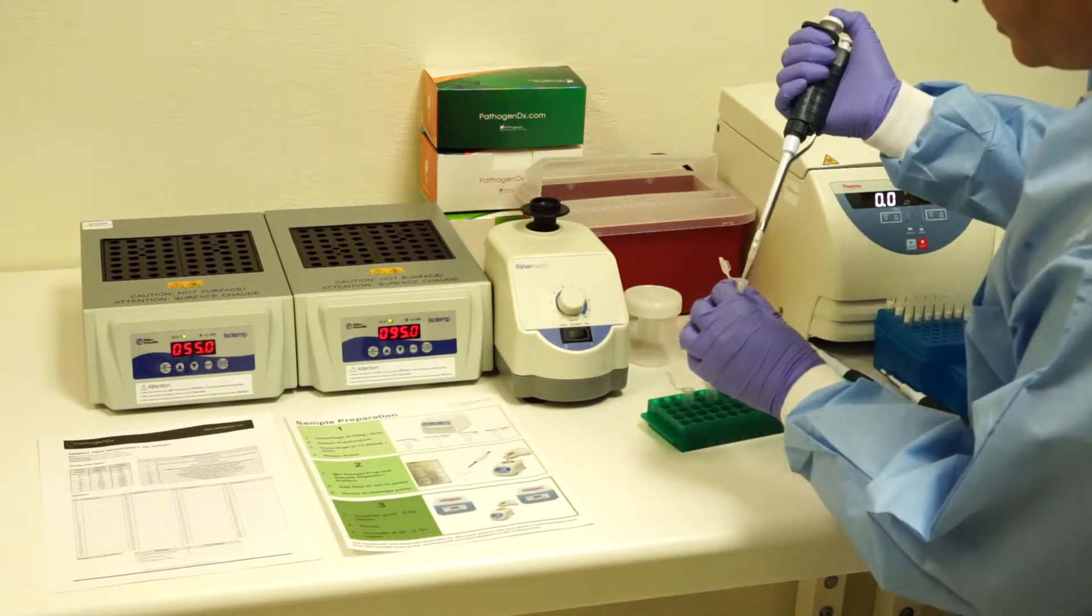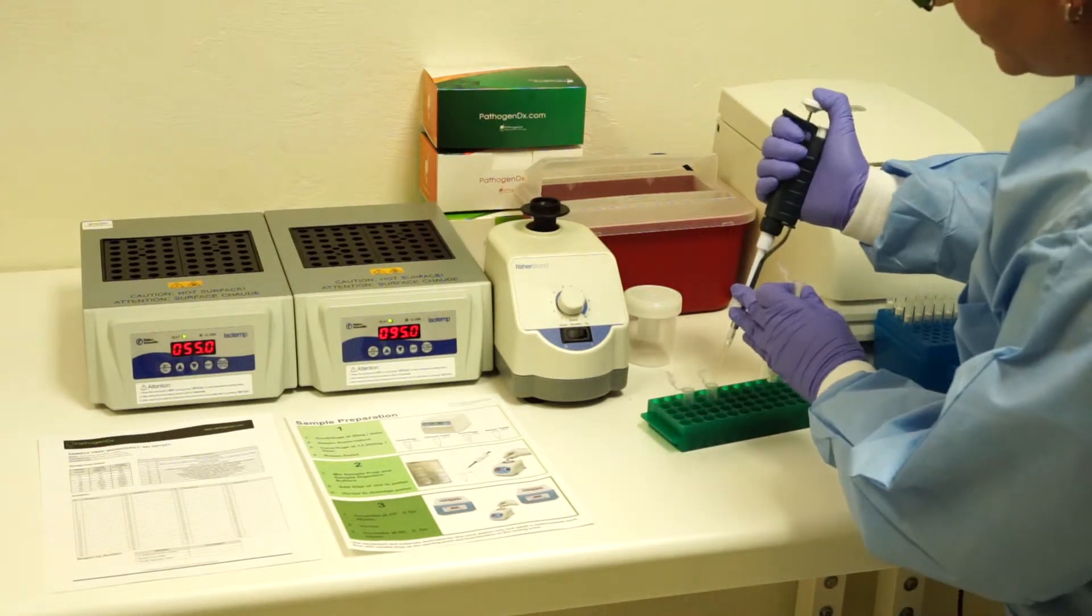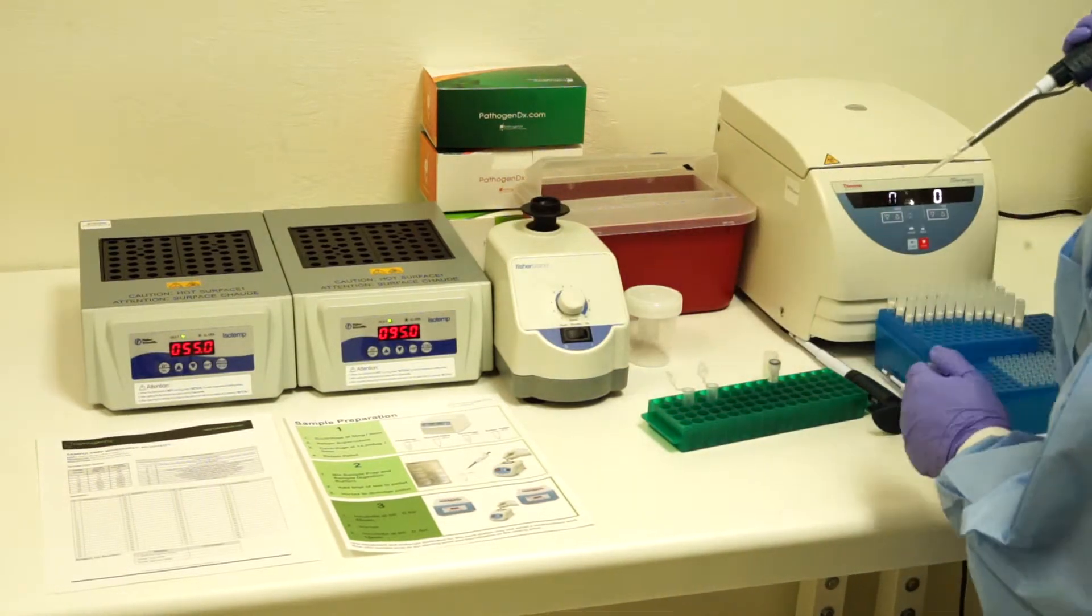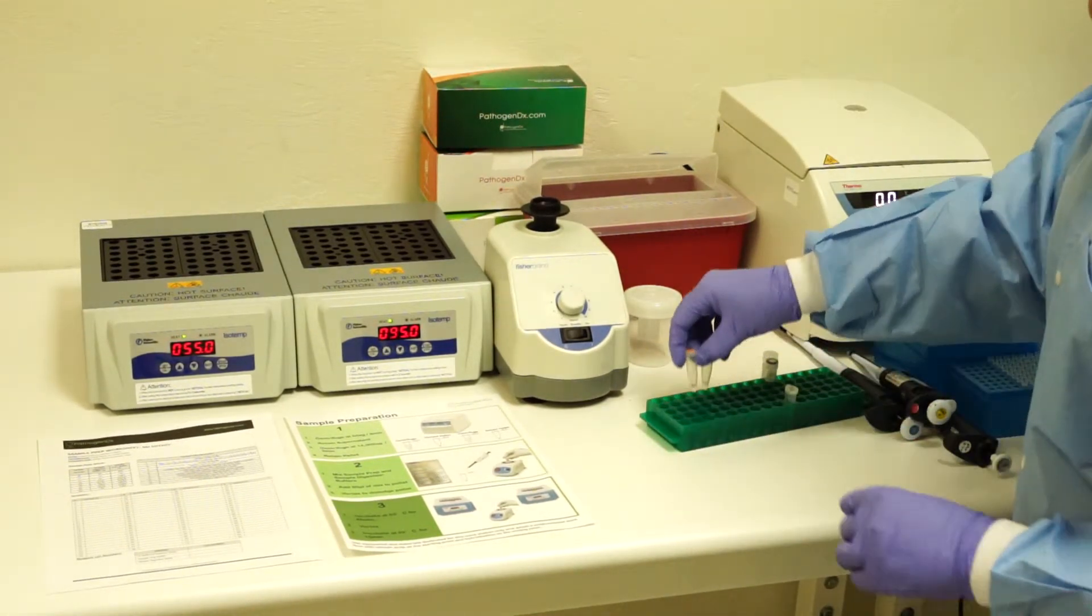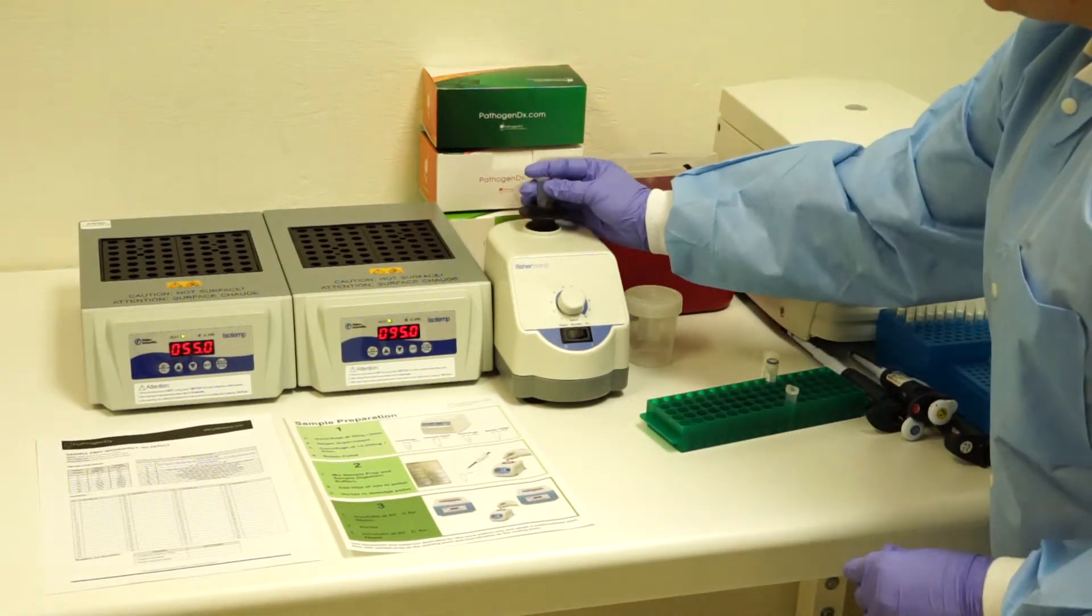The sample prep buffer should be applied carefully to avoid any cross-contamination. Once the buffer is added, the sample should be vortexed for 10 seconds.